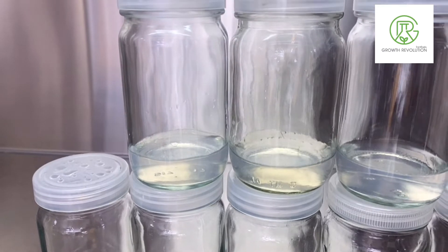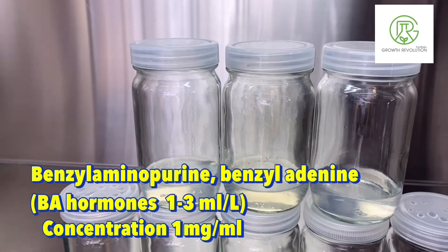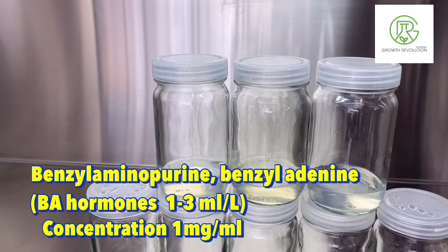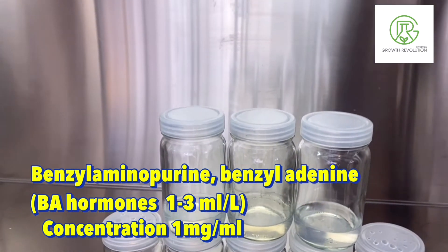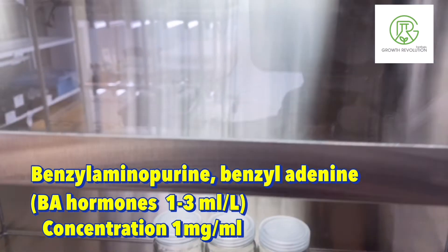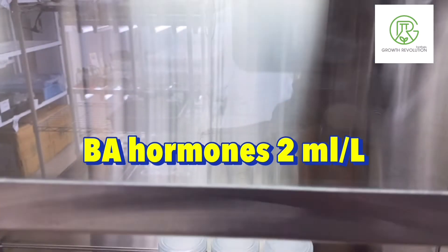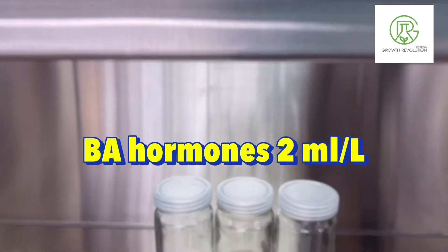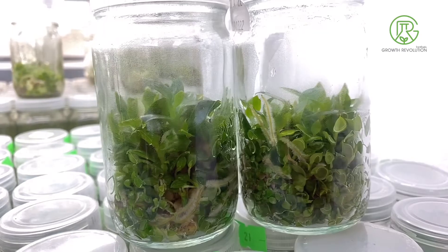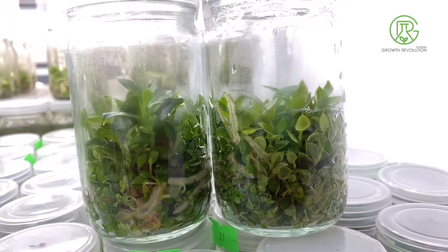Next, we are going to add hormone to our media solution. This hormone is called BA hormone, and it is the main factor that makes the plants multiply. You can add from 1 to 3 milliliters per liter, but here we normally add 2 milliliters per liter, and that works really well.